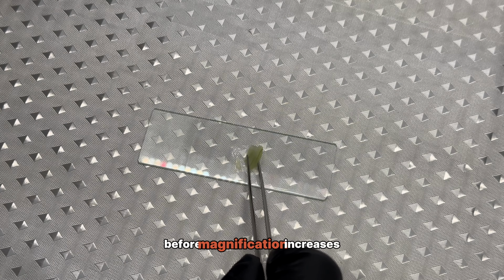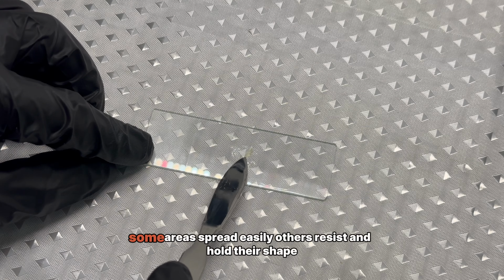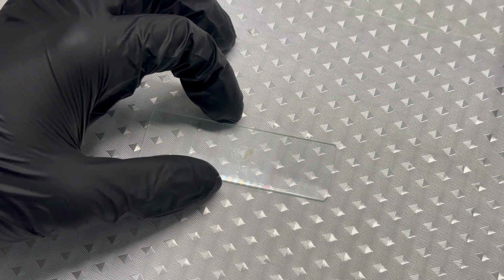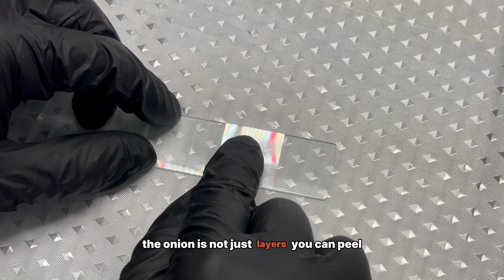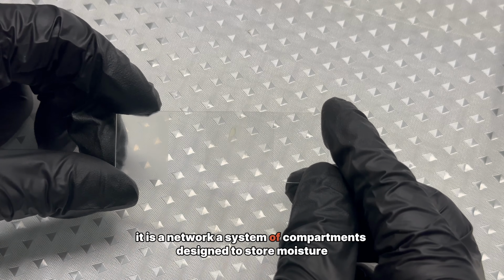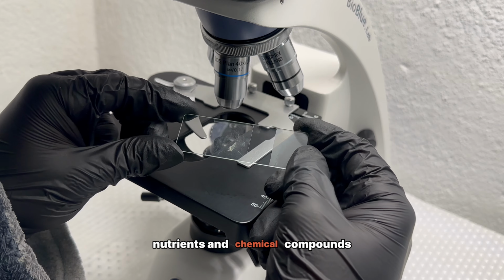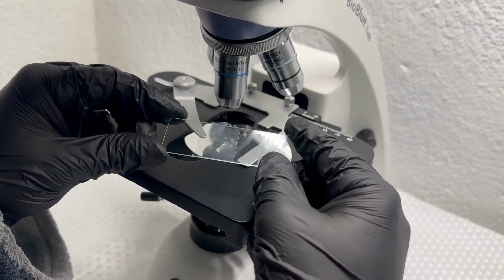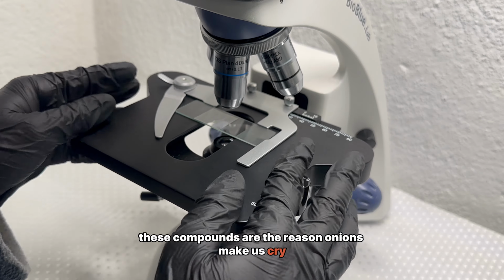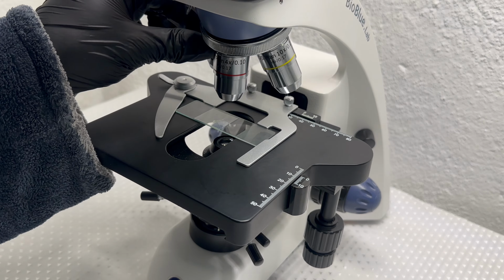Before magnification increases, the surface already looks unstable. Some areas spread easily, others resist and hold their shape. The onion is not just layers you can peel, it is a network, a system of compartments designed to store moisture, nutrients, and chemical compounds. These compounds are the reason onions make us cry. They are released only when the structure is broken.